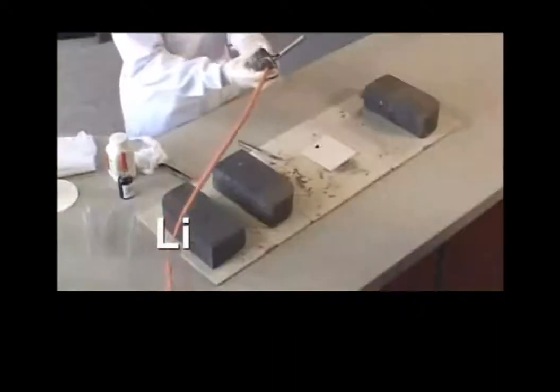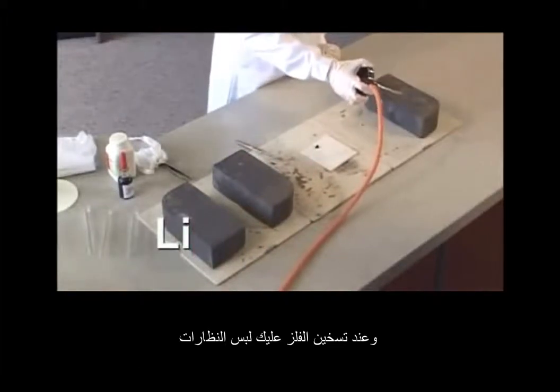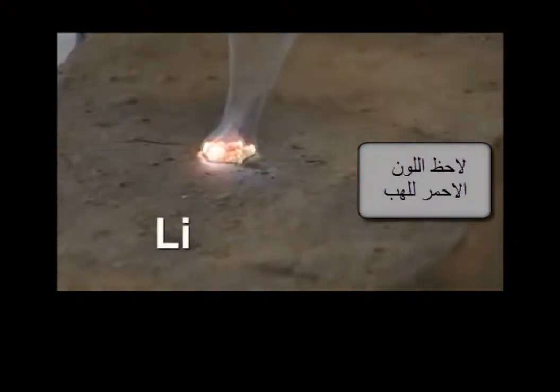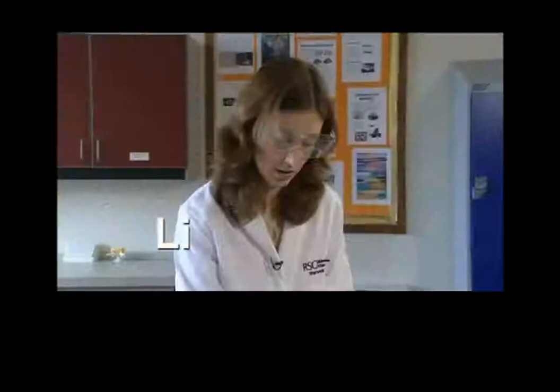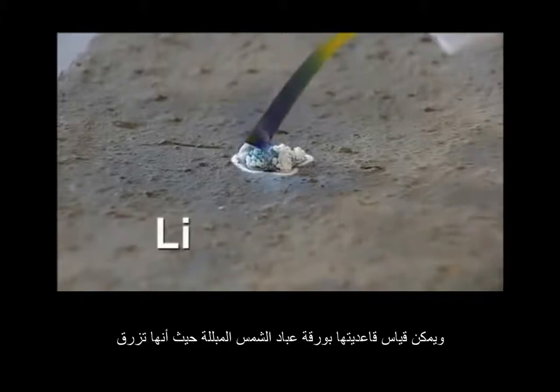Place a little bit of metal on a flat brick. When heating the metal, you need to use a roaring Bunsen flame and position the metal at the top of the blue cone, which is the hottest part. You can test the white residue with some moist indicator paper.